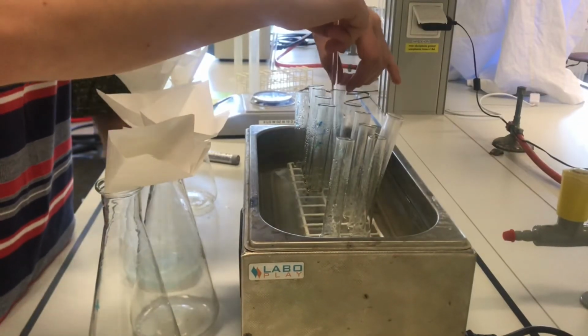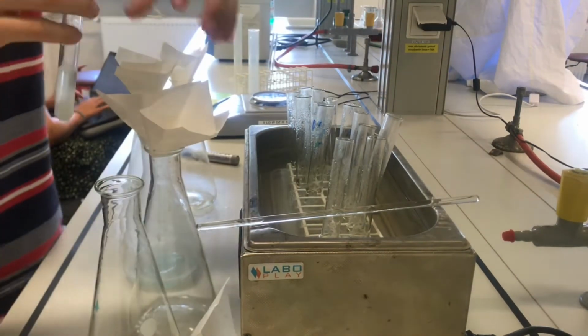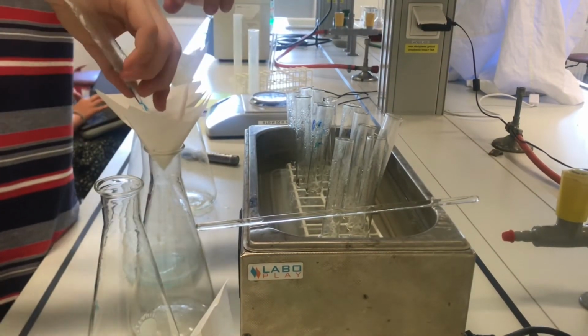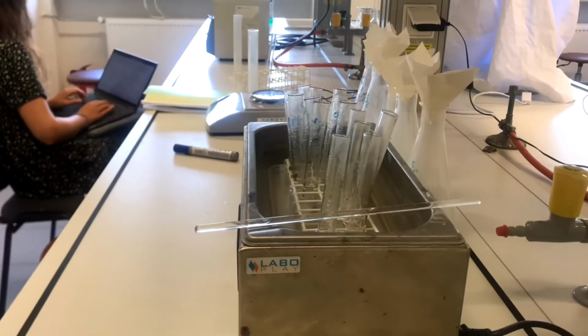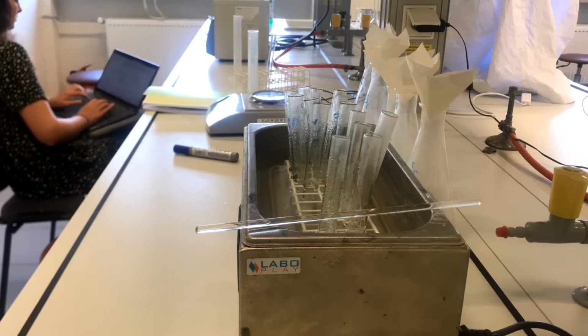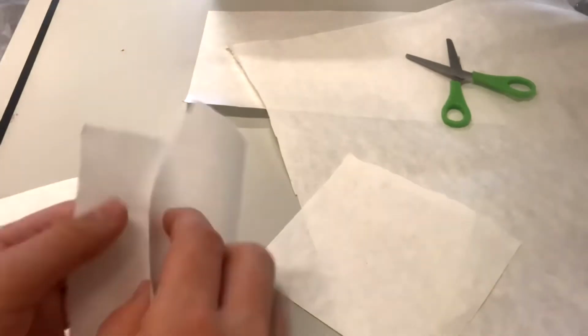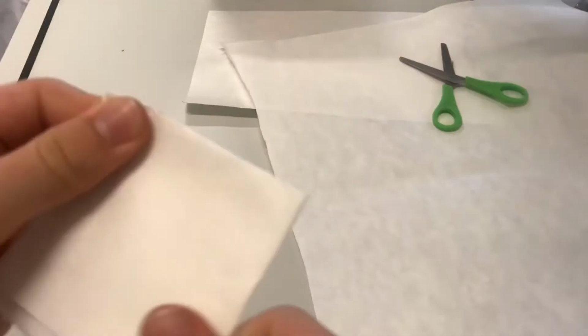After an eternity of waiting, I mixed the salts for the last time and filtered them. As earlier, I cut up the filter paper again for the next salts.